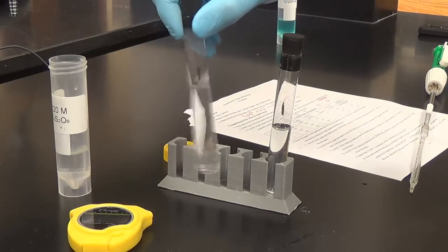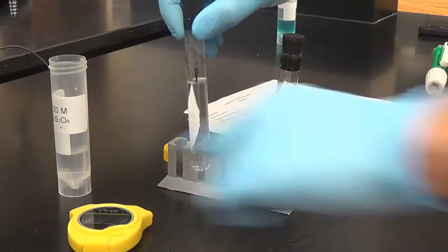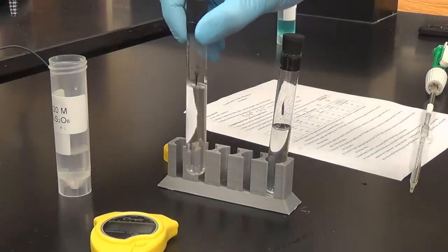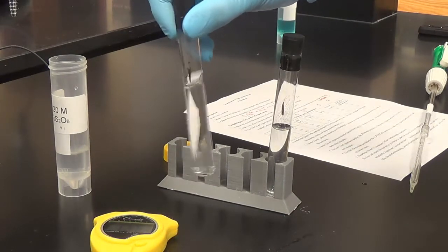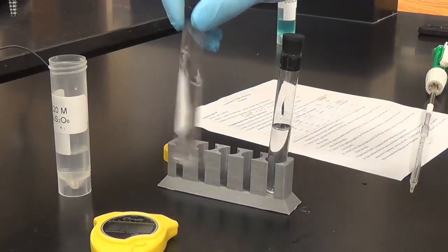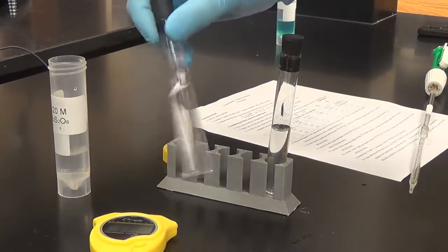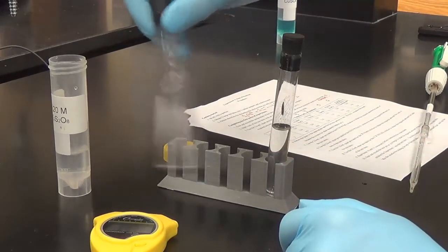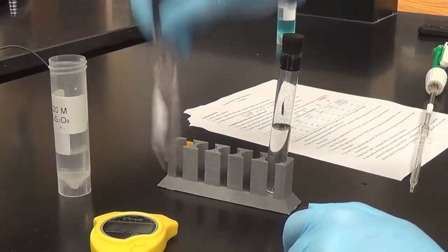So we just keep on shaking or stirring this, and the minute this turns bluish, purplish, we're going to hit stop on our stopwatch timer. Be patient, it may take a while, it's okay. Again, we're looking for something in 2 to 4 minutes, even if it's 5 minutes, that's also fine. Color forms at the bottom, so I'm going to wait till this whole thing turns blue, and then I'm going to stop my timer.